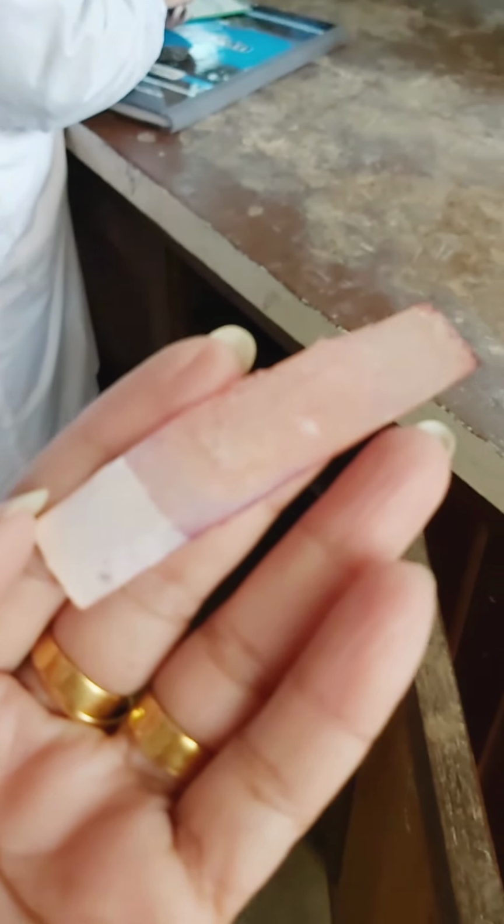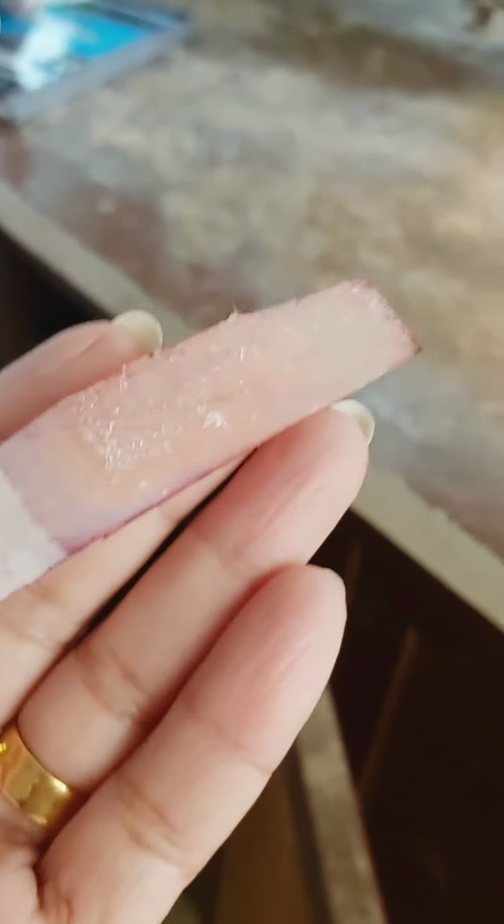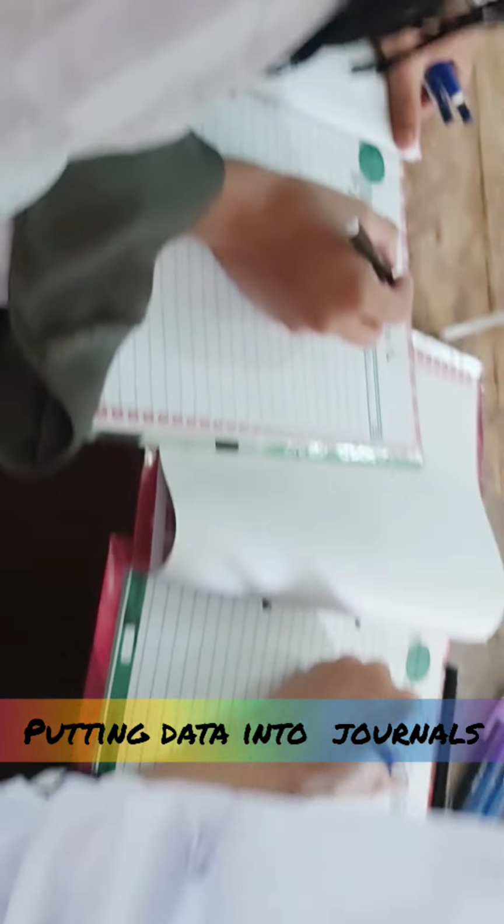The girls have performed the litmus test. This is the blue litmus paper. It turns red, so this is an acidic compound. Students are preparing their journals. I've explained to them how to make the columns. Write down the date of the experiment. Yes, you are supposed to write down the date first and then the object and everything.